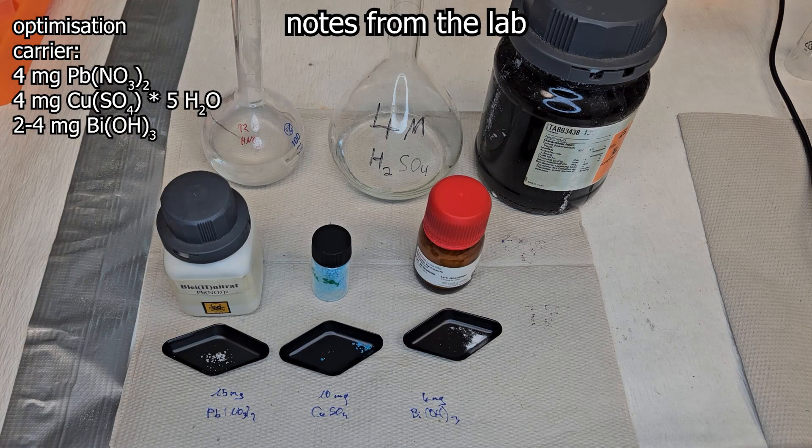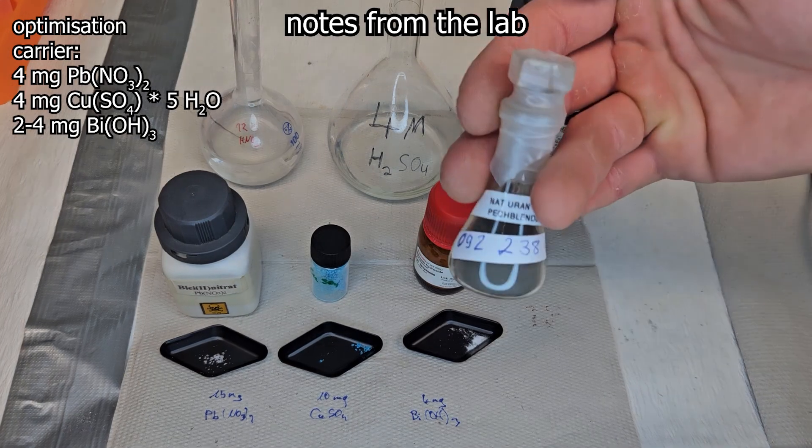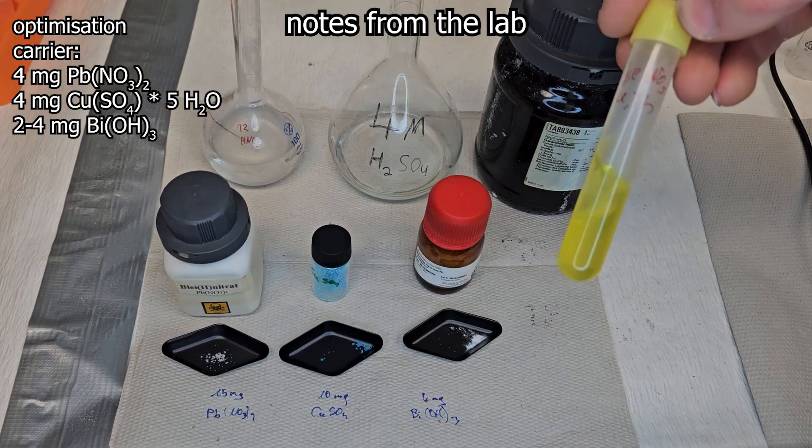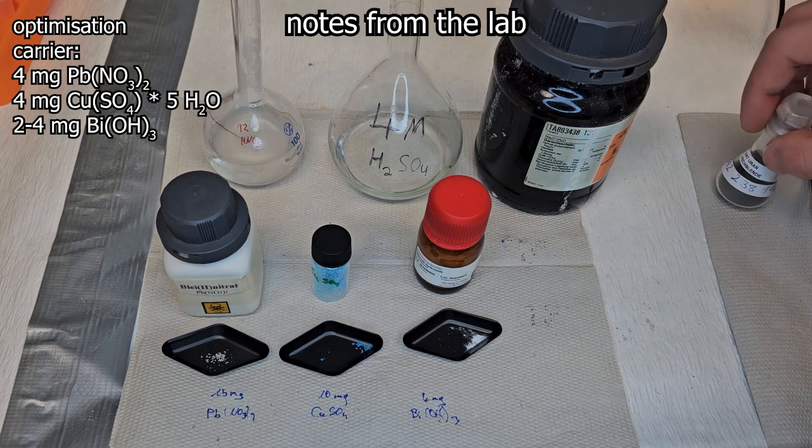Then you won't see anything, but it works much better. Not seeing anything in a video would not be ideal for a video. 2 to 4 mg of copper is also quite sufficient.